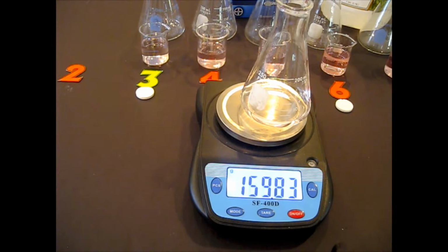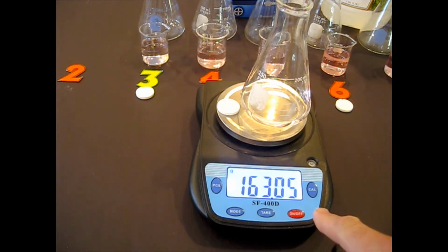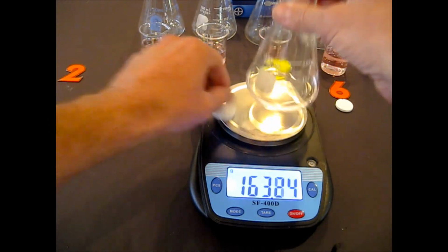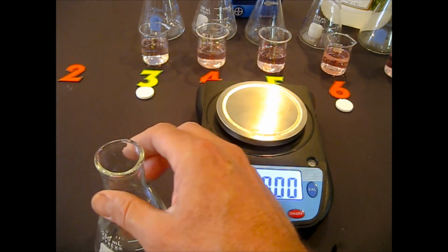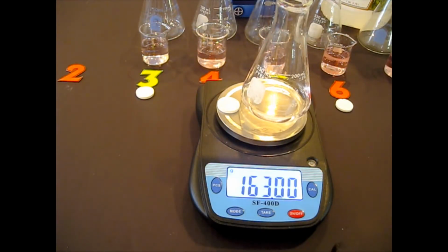And then, oh yeah, make sure to write that down. Make sure, oh, did it change slightly? Interesting, depending on the position, I get a slightly different reading. Okay, just to make sure, let me take these off. Let me tare it, and then I'm going to put them all back on there. Okay, so that's the one I would use. That's the number that I would write in for C.